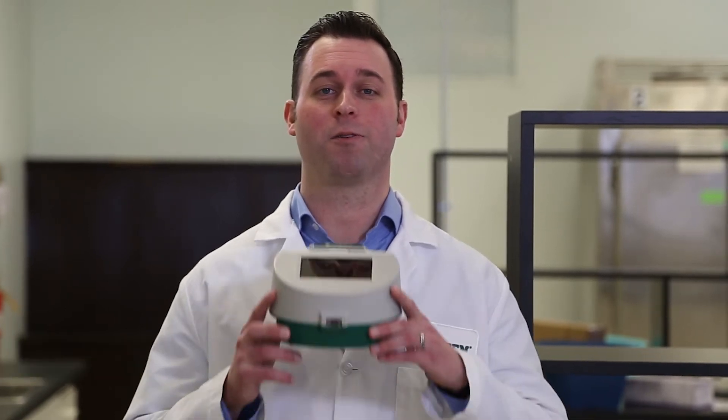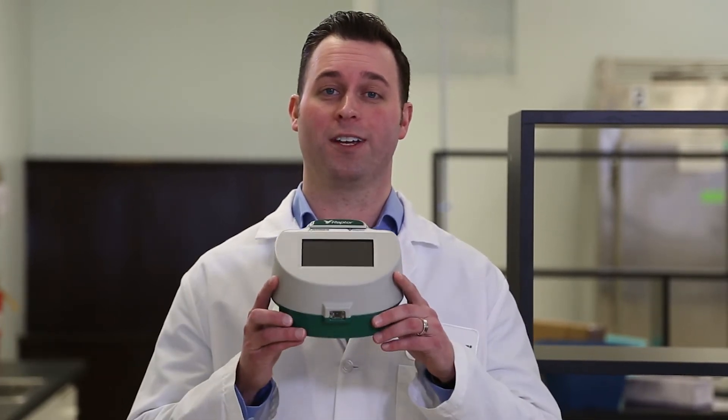Hello. Neogen is excited to introduce the next generation platform for dairy antibiotic testing: Betastar Advanced with Raptor Integrated Analysis Platform. This training tutorial consists of three parts: the Raptor platform overview, in-depth step-by-step training using the FDA 2400 form, and a best practices section. Let's begin.